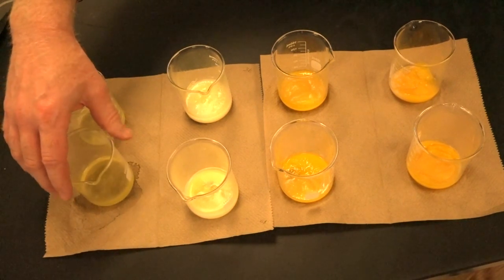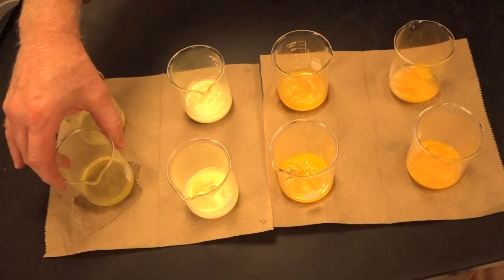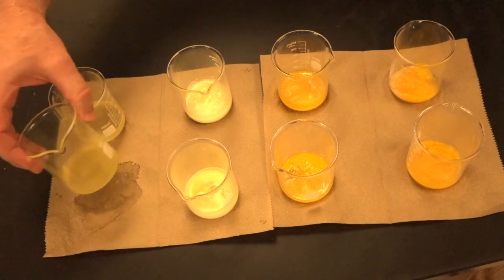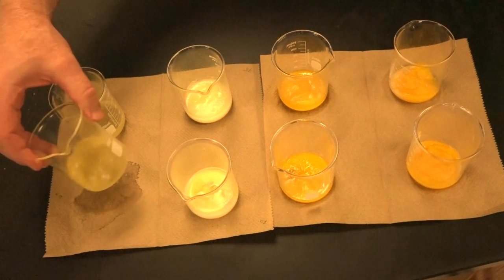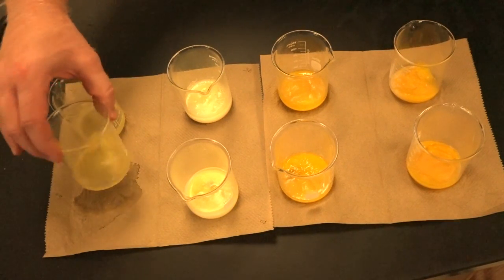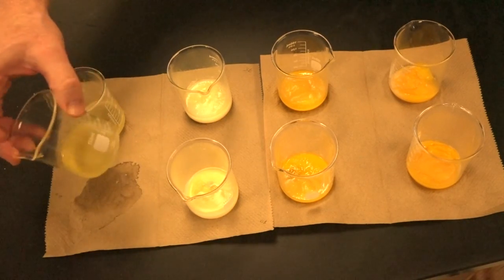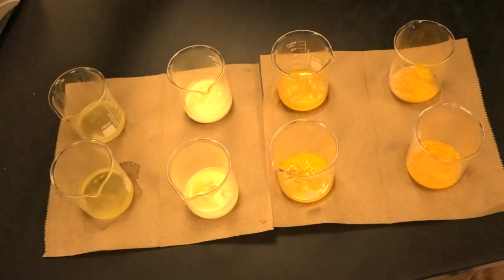And then right next to that, underneath the texture of the egg white, is this liquid. Can you say that okay in the video, Ms. Hall? Is this liquid, semi-solid, or solid? How does this look at 60°C? That's where we pulled this first one out.